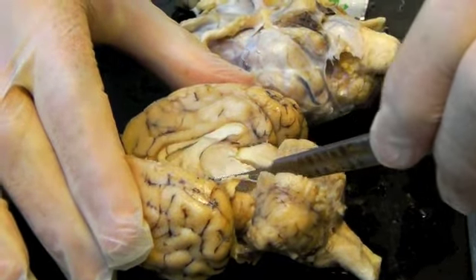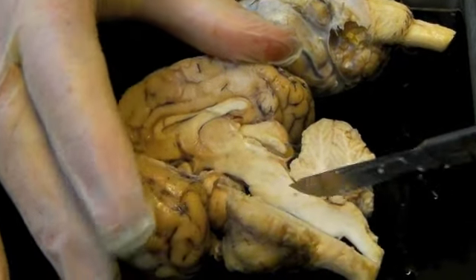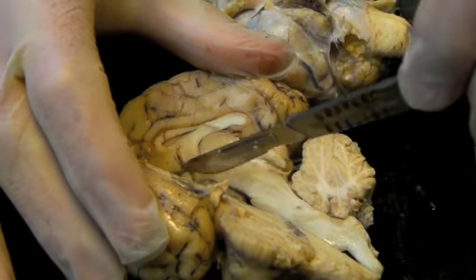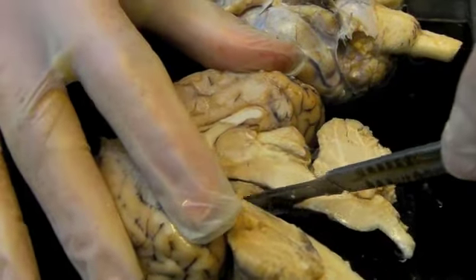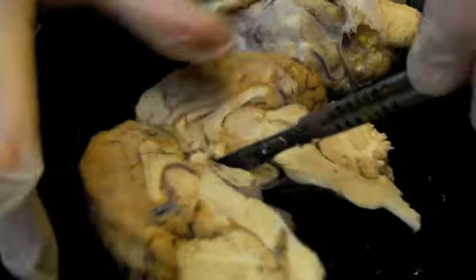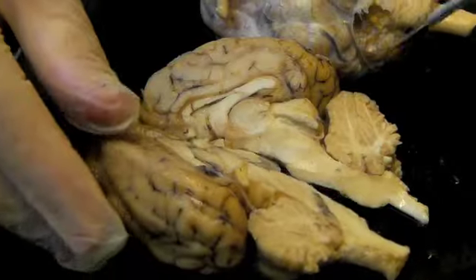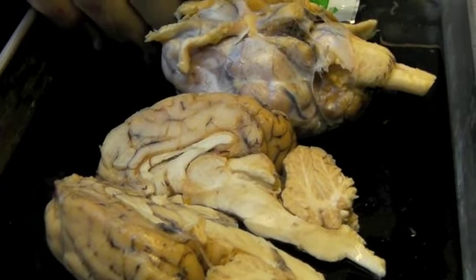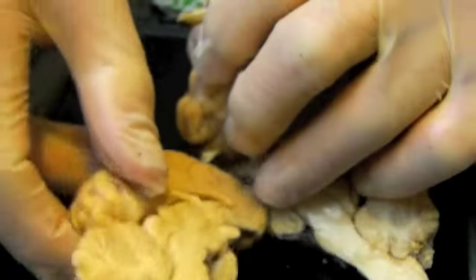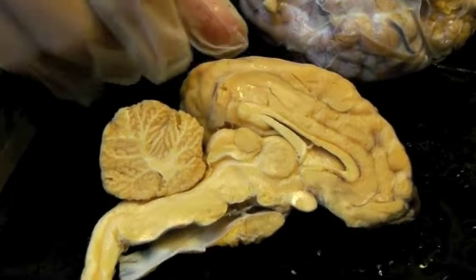So it comes apart nicely like that. You just want to press down with gentle pressure, and then all the way through. And that's pretty tough stuff there. Now, I'm going to switch specimens. I just cleaned that up a little bit and want to show you this section.